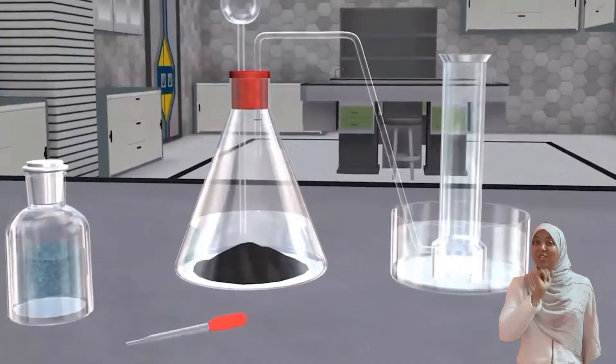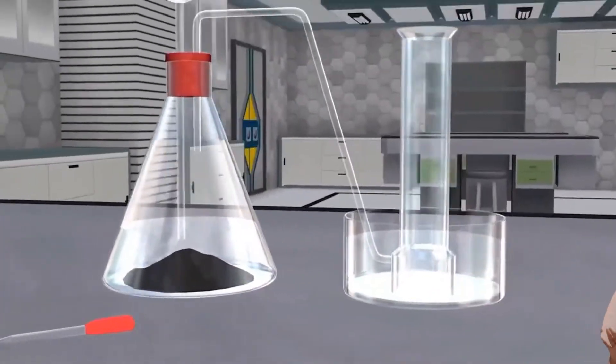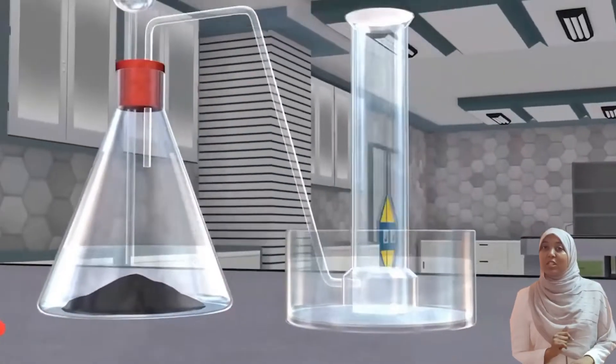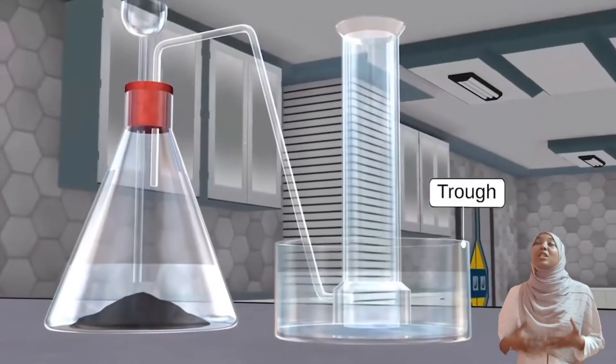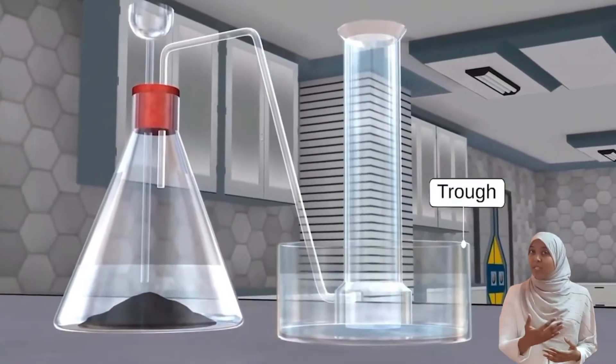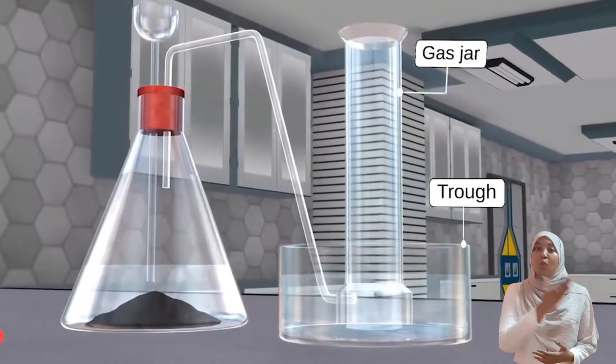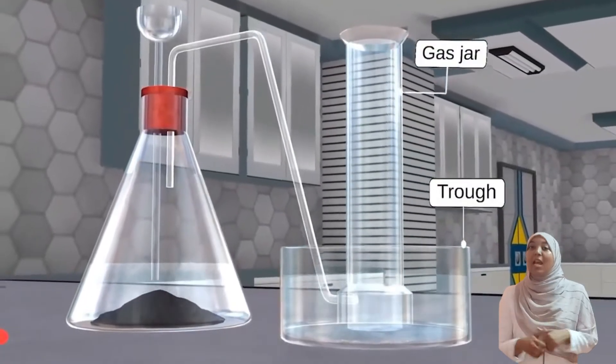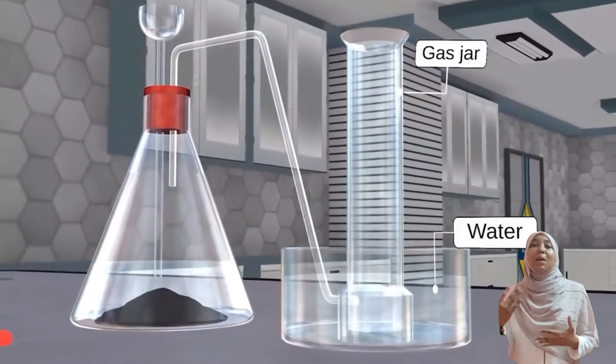Hydrogen peroxide is our first reagent. Hydrogen peroxide is a colorless liquid that naturally decomposes over time, leading to the formation of water and oxygen gas. But this process usually takes a bit of time.